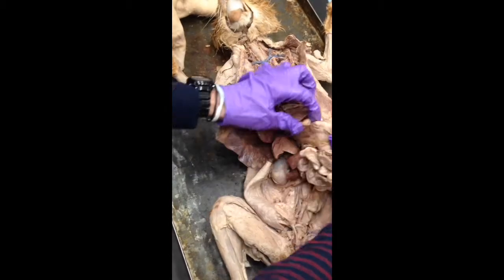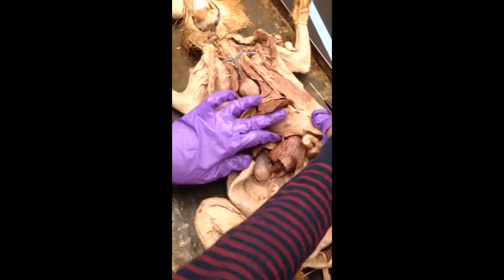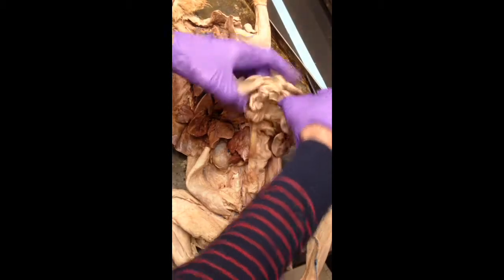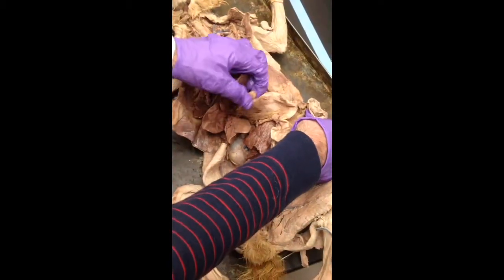Right, and once we're there, we've got to start looking for our pancreas, and now it's right there. So again, that fleshy bit, that's the pancreas. If we look at all the rest of this stuff, it looks all spiderwebby. There it looks all fleshy and meaty.